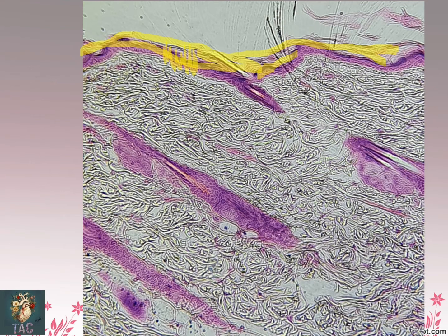Also you can see this is the section of the hair follicle, and in addition to the hair follicle, here you can see a section of the sebaceous gland which is present over here. This is the section of the erector pili muscle, that is the smooth muscle which is present in close relation to the hair follicle. So this is another hair follicle, and this is again another section for the sebaceous gland. This all is the dermis, which is the dense irregular connective tissue. This area is again another section for the hair follicle. This is another section for hair follicle.